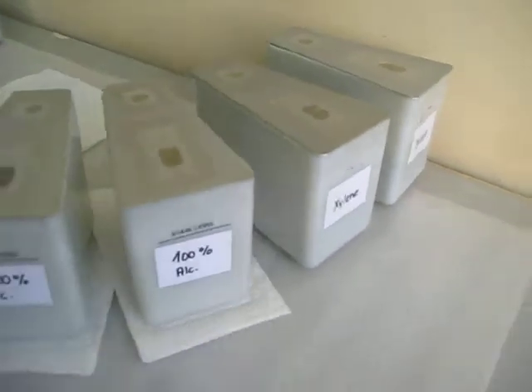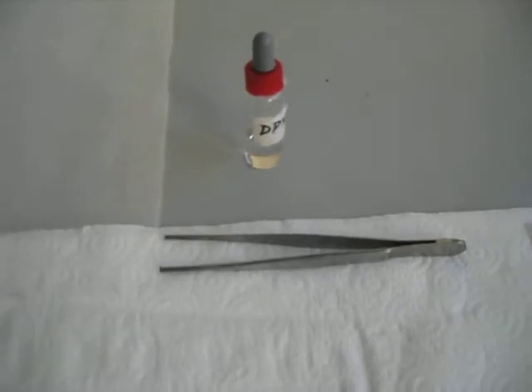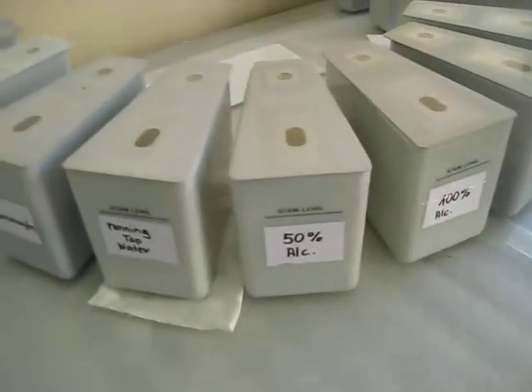After two changes of xylene you come to your mounting stage, at which point you use your DPX, and then you have your cover slips. You notice that we have about 12 different stations in total.